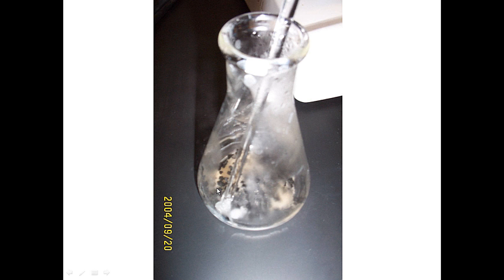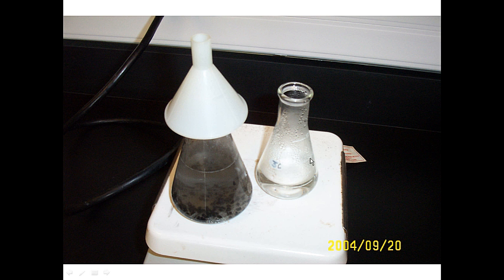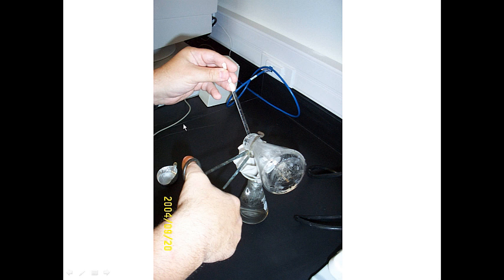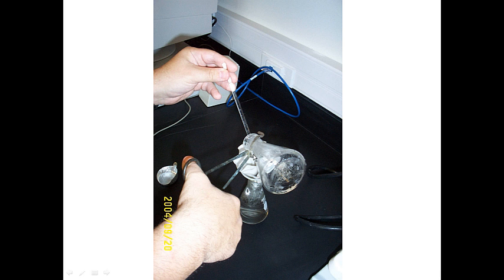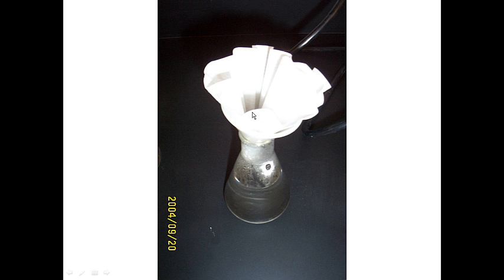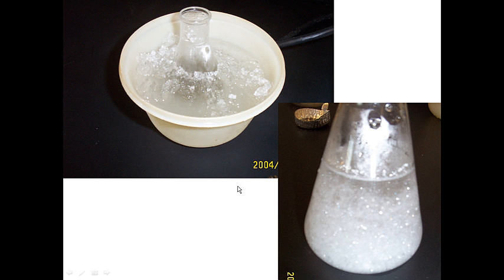There may be some solid and impurities left in the Erlenmeyer flask. Pour a little hot solvent back into the flask, heat if needed to dissolve any remaining white solid, then pour that hot mixture back through the filter. This second pouring also dissolves any crystals that may have formed in the filter paper and moves them through to the final solution. At this point the solution should be relatively clear and colorless. If decolorizing charcoal passed through the filter it will give a slight grayish tint — re-filter if necessary.